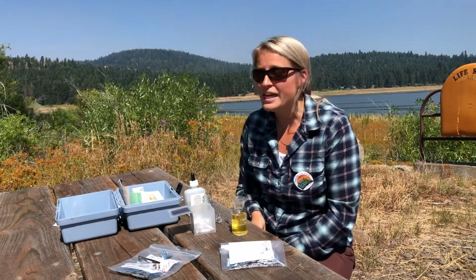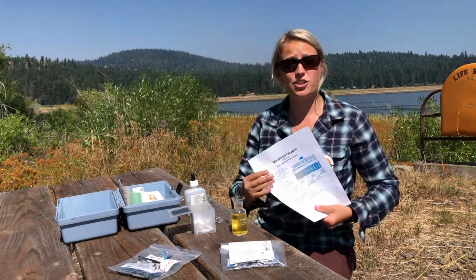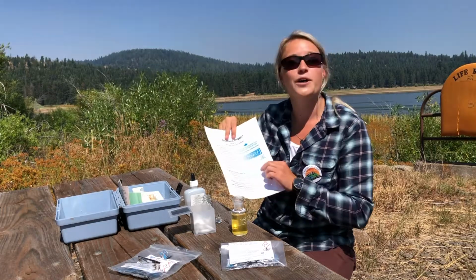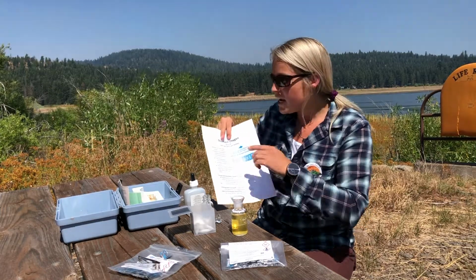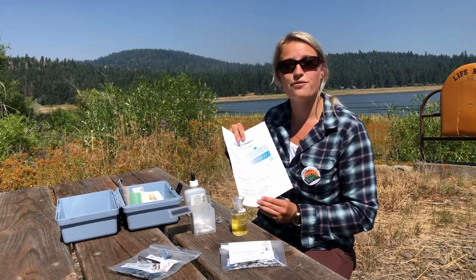So what does that mean? So now I want you to take the information sheet about dissolved oxygen, similar to what we did with pH, and I want you to see where 6 falls on the DO scale, and then read some information about if that is good or bad to support life for large fish.